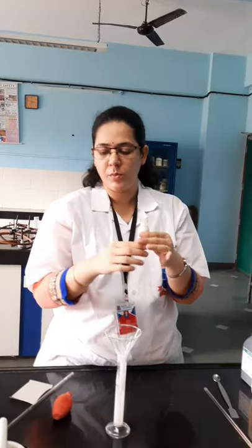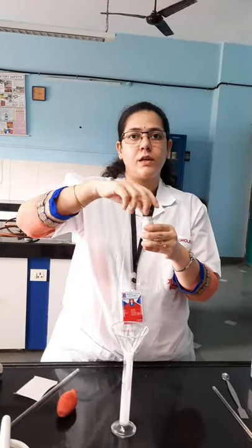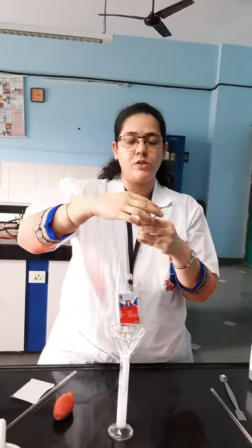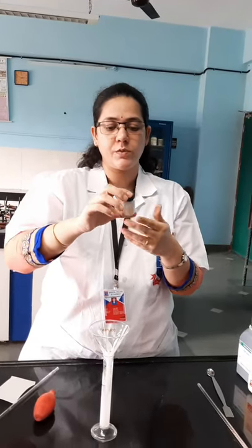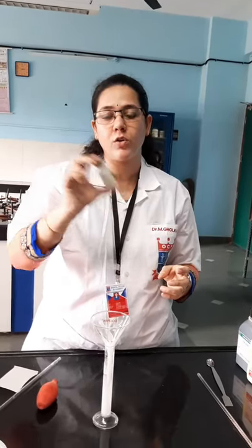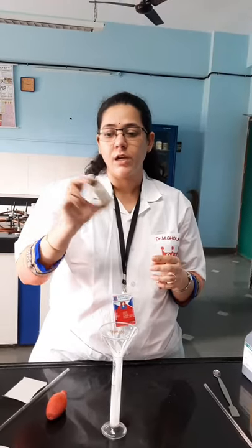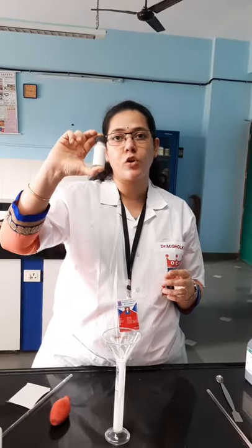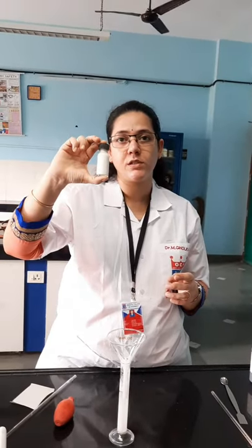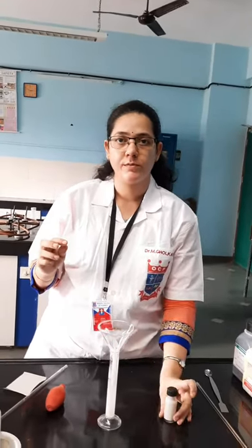Cap the bottle properly and then label it according to the instructions. Since this is a suspension, you will have to write on top of the label to shake well before use. It is meant for topical application and is not an internal use formulation, so you have to mention these things on the label.